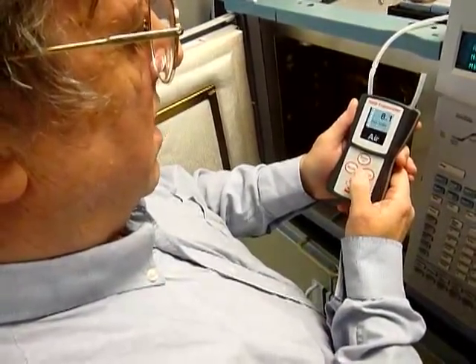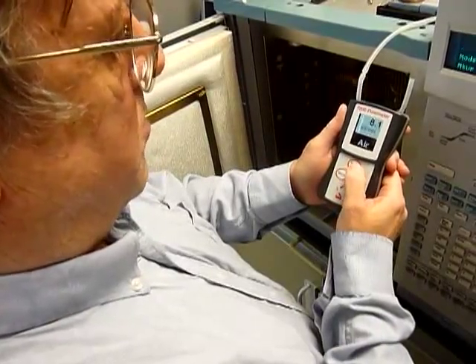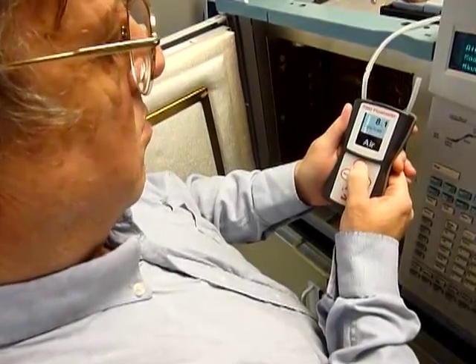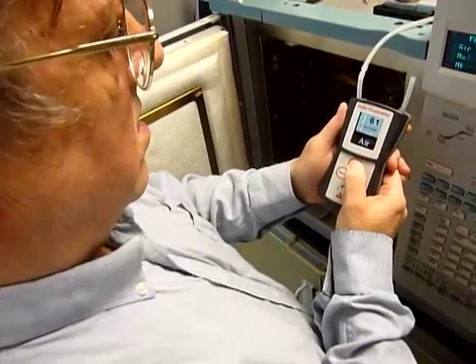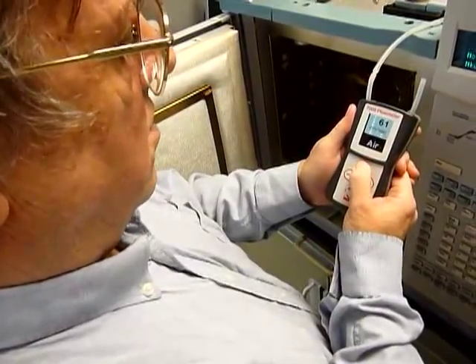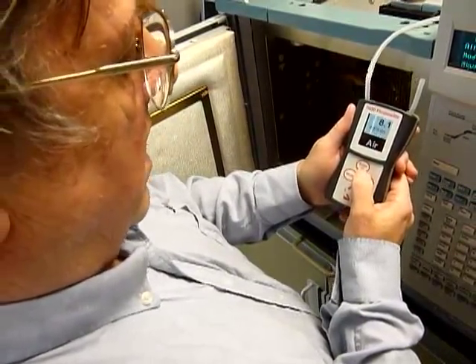To change to a speed measurement, press enter. To change back, press enter again.